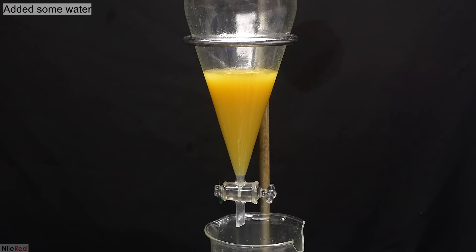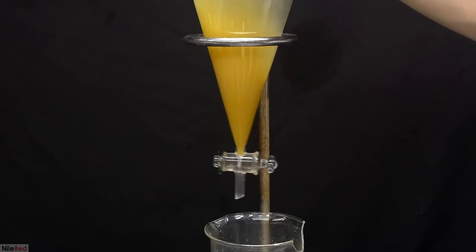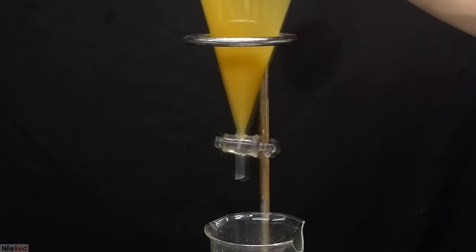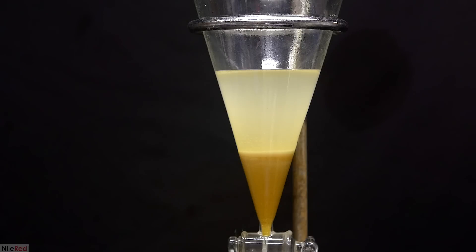I mixed things around, but I made sure not to shake it too vigorously because I really didn't want to have a suspension again. After leaving it for a while, I was very relieved to see that it separated into two layers. This time we're using distilled water and not saturated salt, so the oil is more dense and it sits at the bottom.